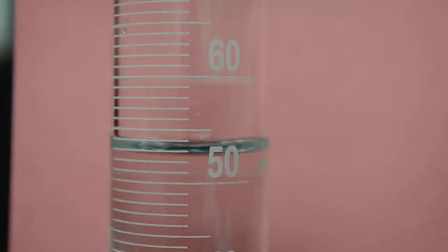And then finally I have to guess that last spot. It looks like it's just below 53, so I would read this as 52.8, 52.9. Either of those readings would be fine, and of course we would add the unit, milliliters. So 52.8 mL, and that's the reading.